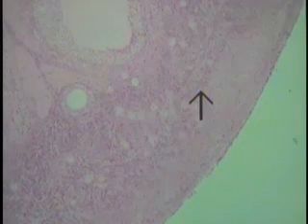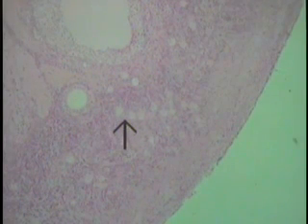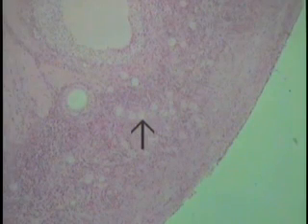To help in this endeavor, examine a section of the ovary. The ovary contains extraordinarily large cells referred to as ova. This is a section of the ovary. This is the external boundary of the ovary on this particular section, indicated by the arrow. If one proceeds into the cortical region of the ovary, a narrow band of cells can be found. These are the ova — extraordinarily large spherical cells, as indicated at the tip of the pointer.